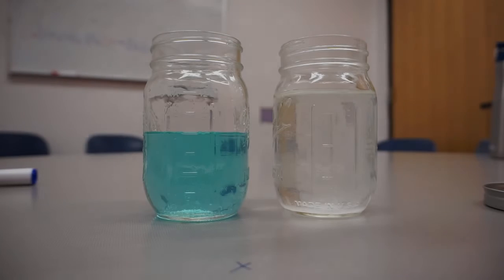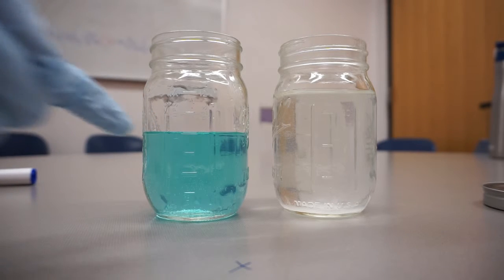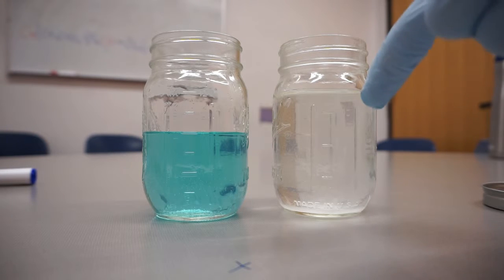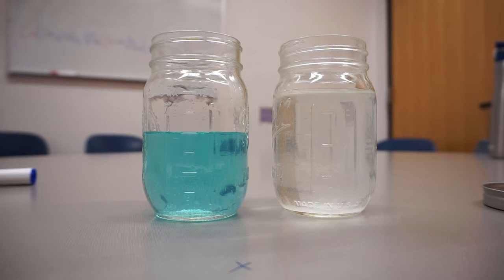The jar on the left is filled with acetic acid, in which copper from 5 pennies has been dissolved. The acetic acid was obtained from household vinegar, which contains about 5% acetic acid. The solution is blue due to the copper oxidizing once in solution. The jar on the right contains sodium hydroxide and water. The sodium hydroxide was obtained from household lye, which is 100% sodium hydroxide.